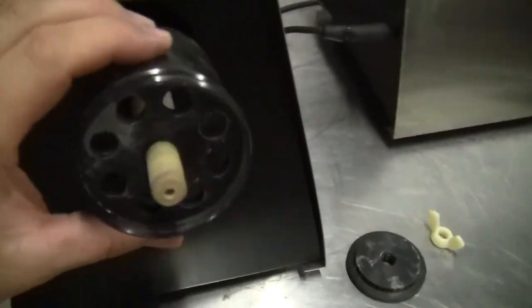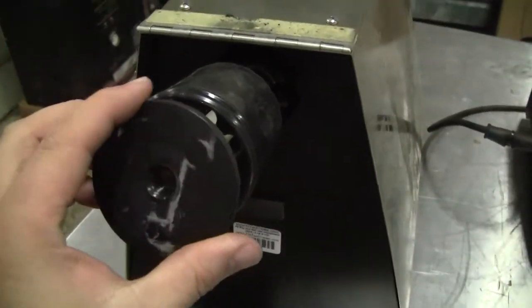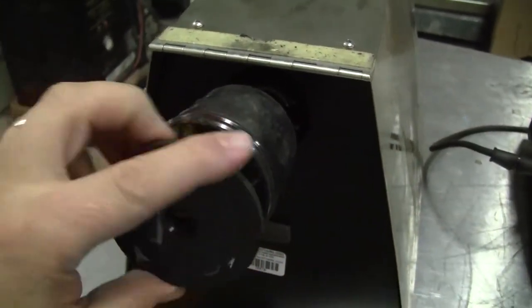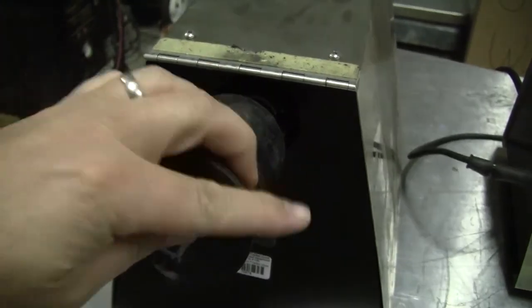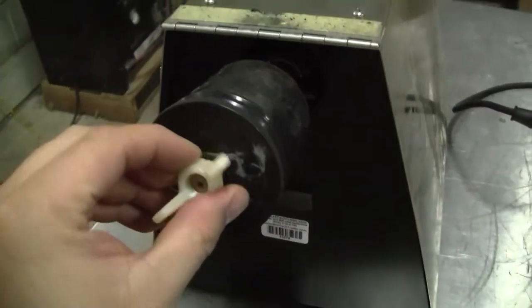This particular product is used for your samples. You would then put your cap on, spinning it on. Your lock nut.